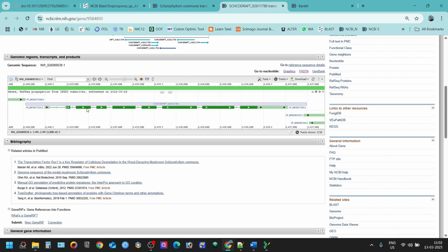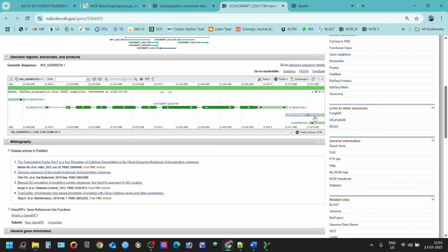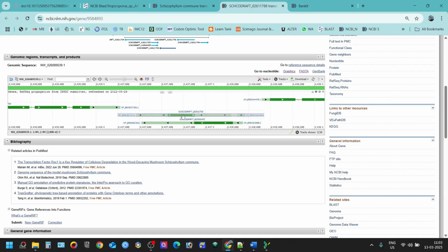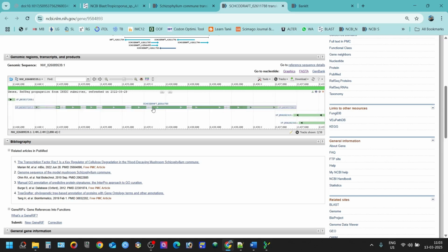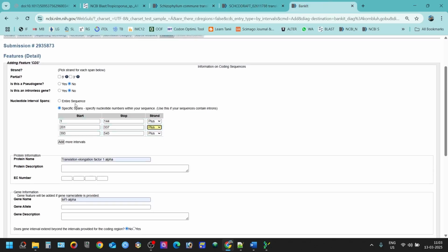You can see this is the gene, and this arrow indicates what the sequence is, for example if it is a minus or plus sequence. If the arrow goes toward the right, then this is your plus sequence, and if the arrow comes toward the left-hand side, then this is your minus sequence. For example, all these proteins are minus sequence, and all these proteins are plus sequence. So our protein is this one, and this is a plus sequence. If you are mentioning the entire sequence and you find something like plus and minus, then you can choose plus from there.